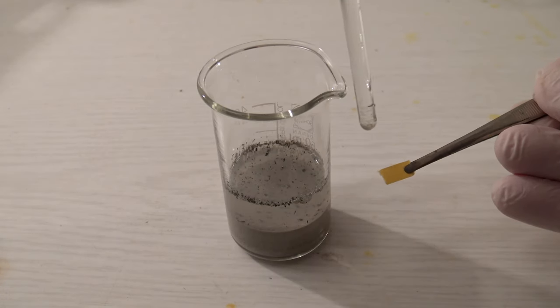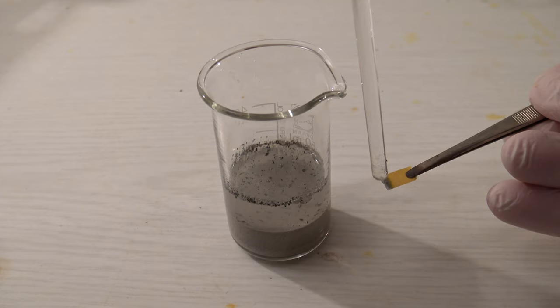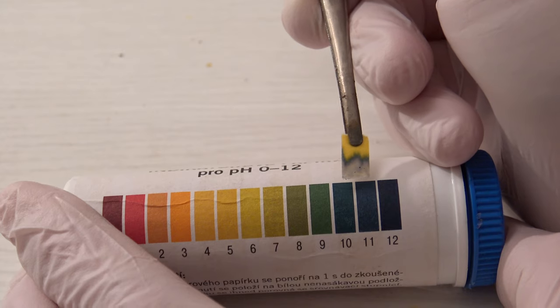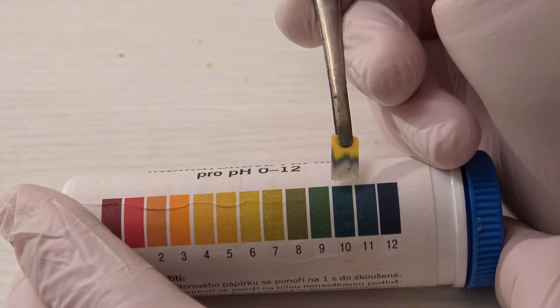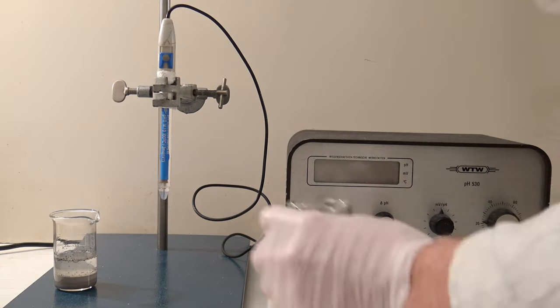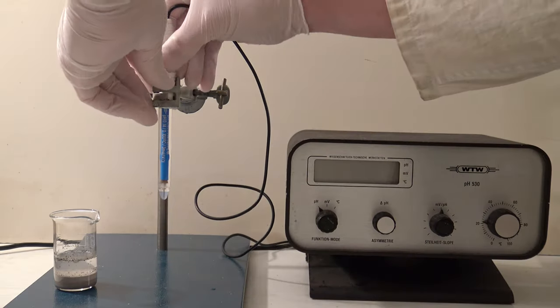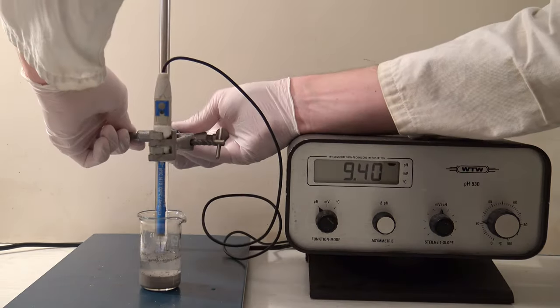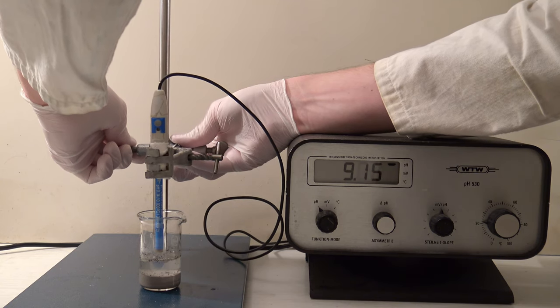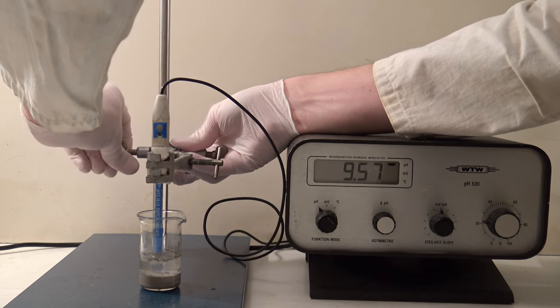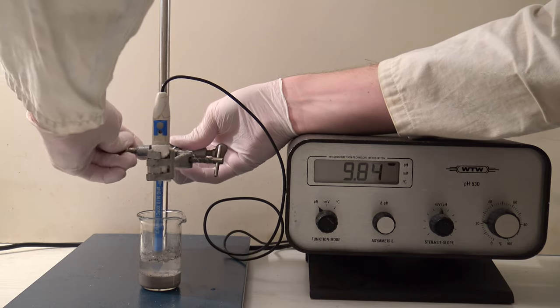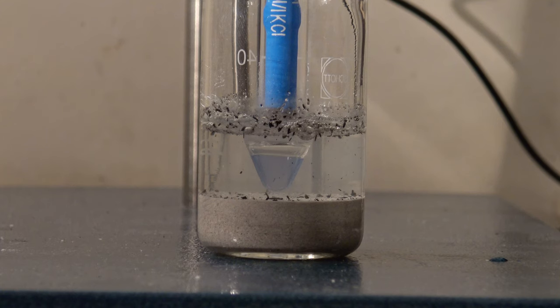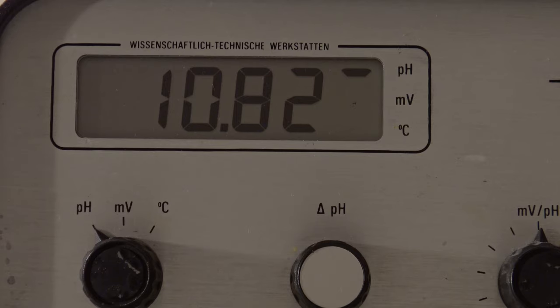The solution is alkaline and has a pH of 10 or 11. Out of curiosity, the exact value was measured with a pH meter. It was taken care that the glass electrode does not sit in the insoluble part. The pH value at the end was 10.82.